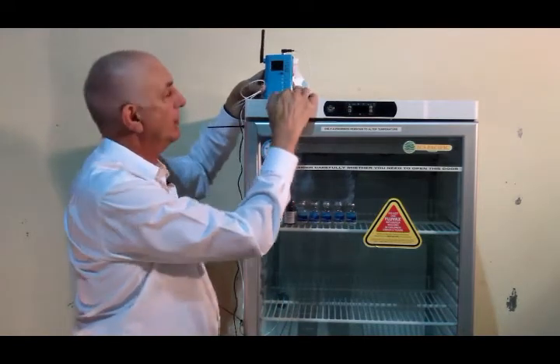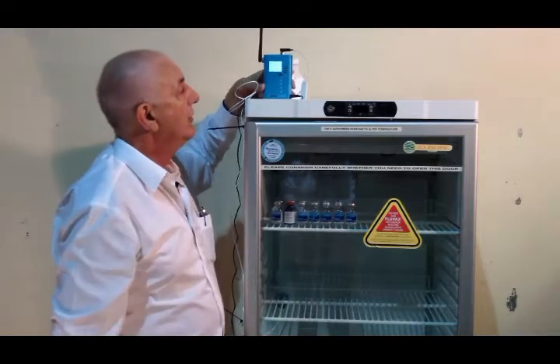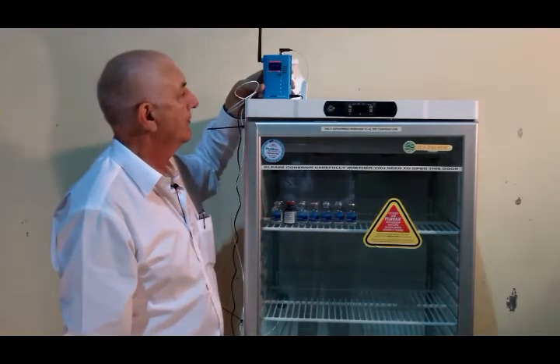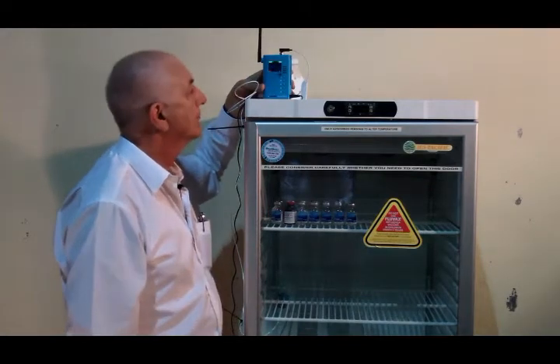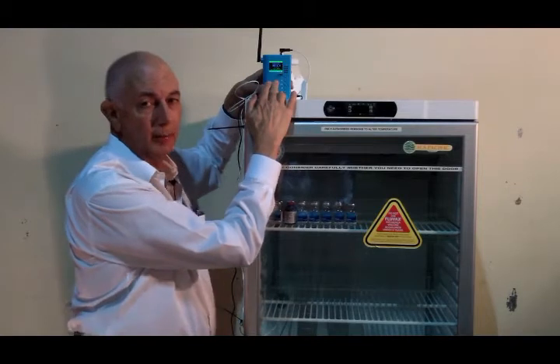If you ever need to have a look at the temperature in the fridge, if you push the bottom arrow, it will show you the current temperature in the fridge. We'll show a close up of that in a second.